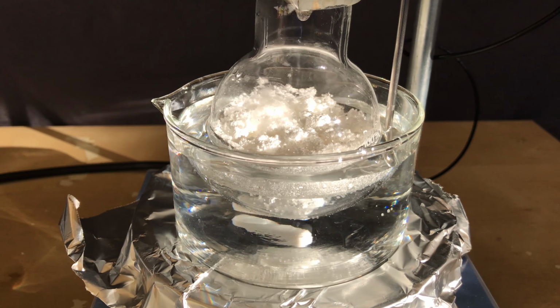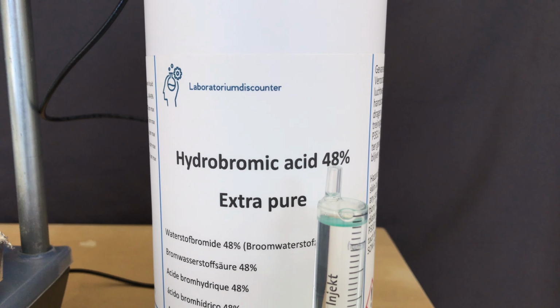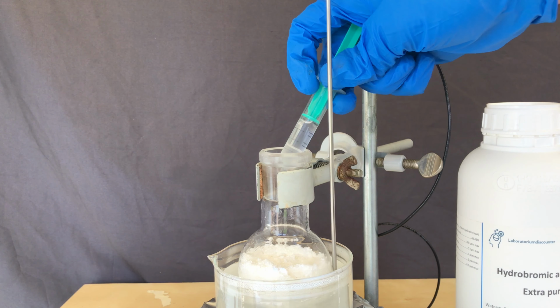We stirred and heated, and I hoped it would dissolve. With benzhydrol, it would dissolve, because with benzhydrol this is going to work, but with 9-fluorenol, it seemed not to work. The hydrobromic acid was added, and still nothing happened.